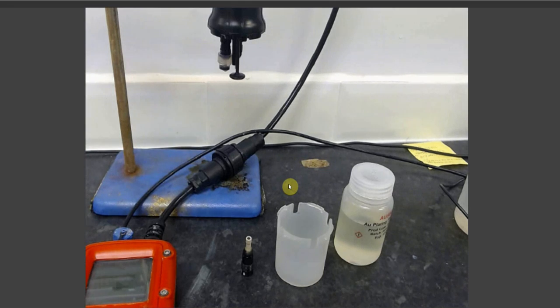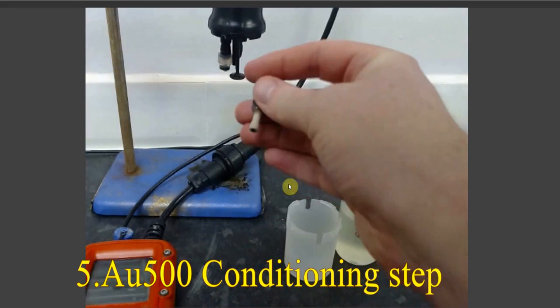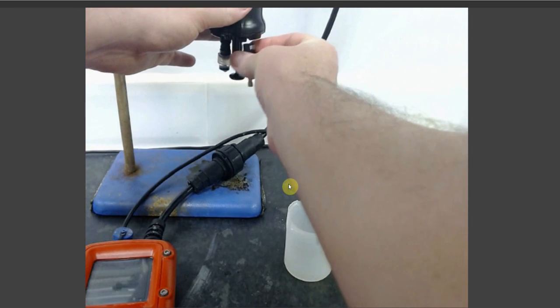Once you have polished your WE2 electrode, you are ready to begin your gold plate. To do this, take your polished electrode and attach it into the WE2 slot of your sonde.